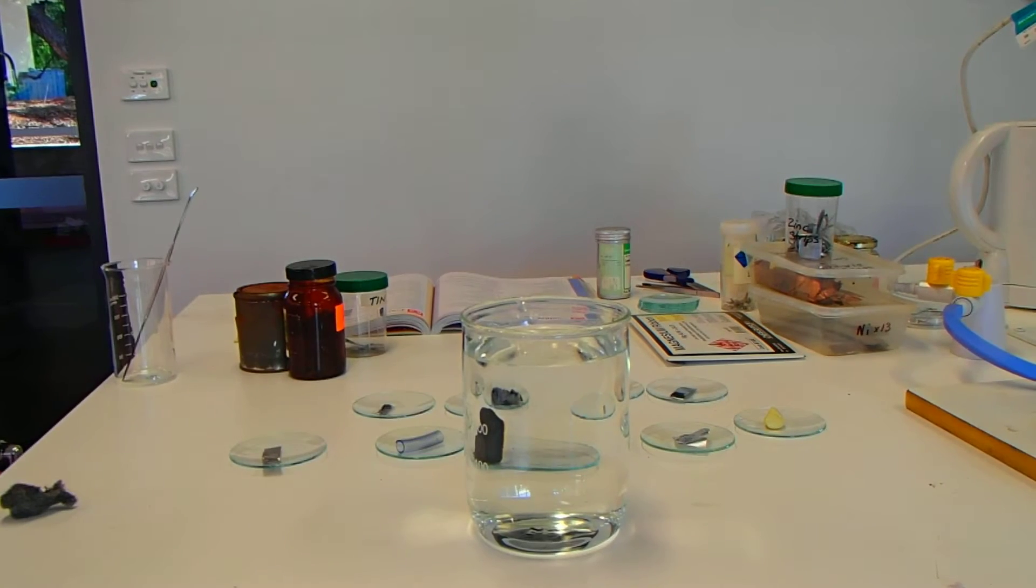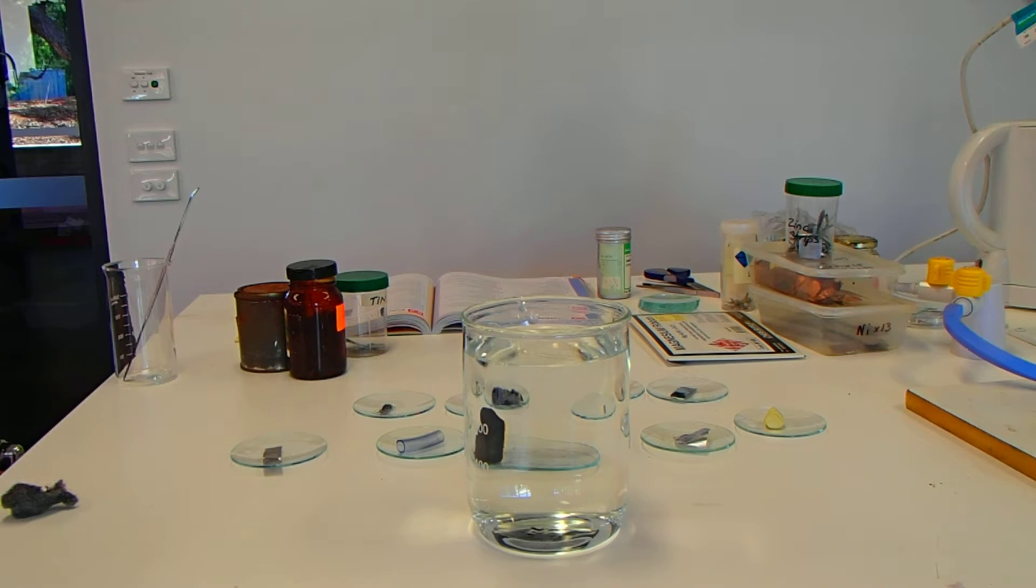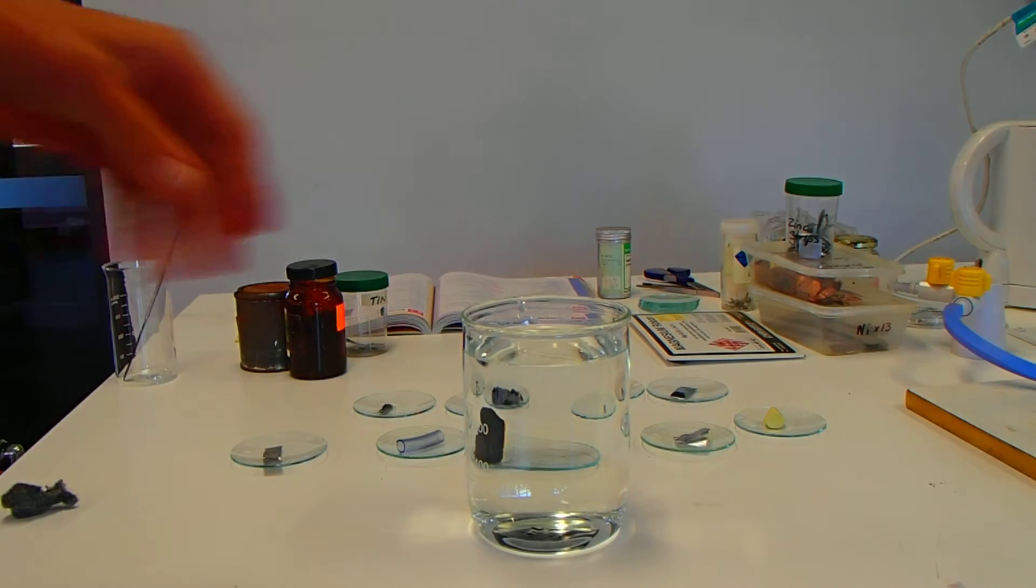Hi, we're back to practical 5.2, properties of the elements, looking at properties of metals and non-metals. We're now up to video 4, sample 4. You should be recording this into your books or onto your computers. But now we're looking at, does it sink or float? So let's have a look.